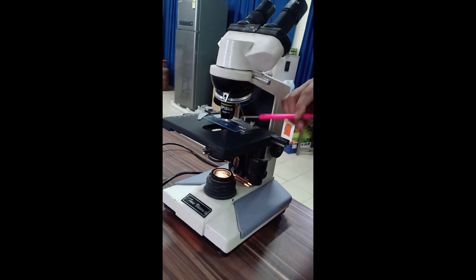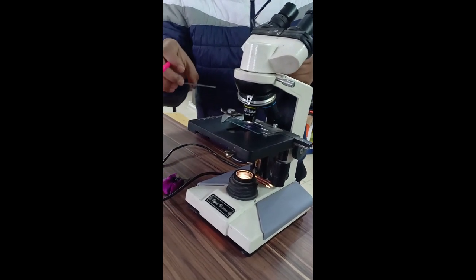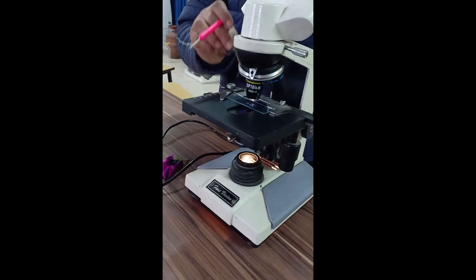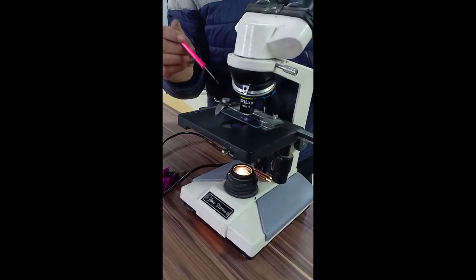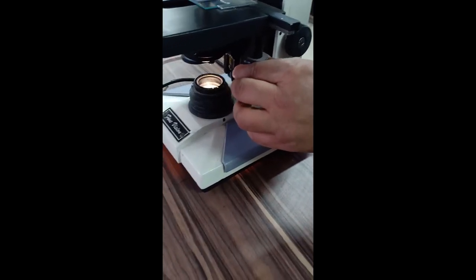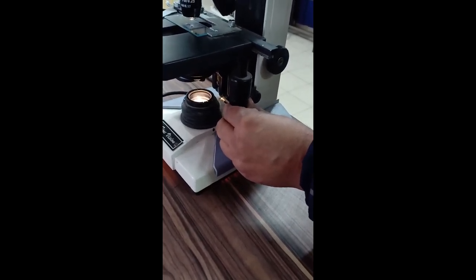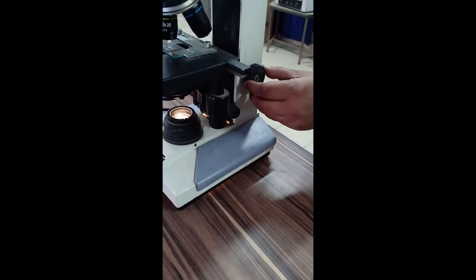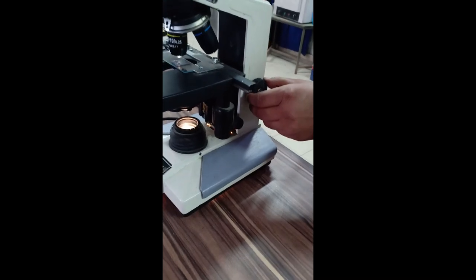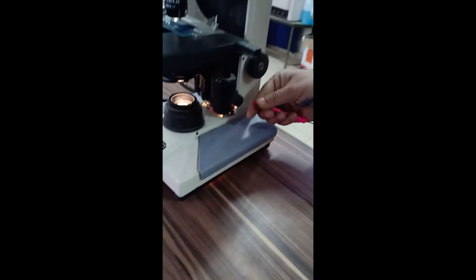The platform has a forward-backward adjuster and a left-right adjuster for positioning the slide. There is also a coarse adjustment and a fine adjustment knob. Use the coarse adjustment to roughly position the slide, then use the fine adjustment for precise focusing of the sample.